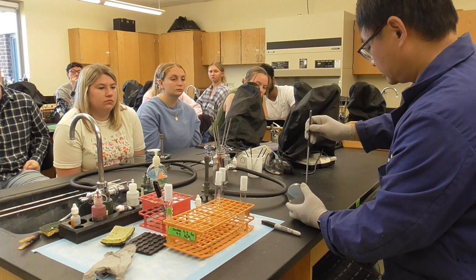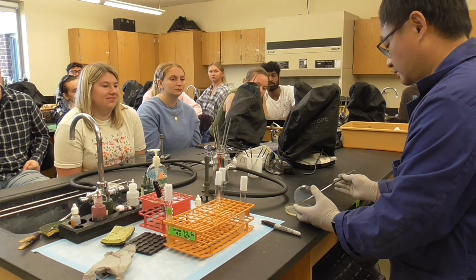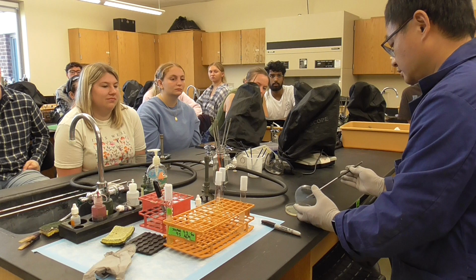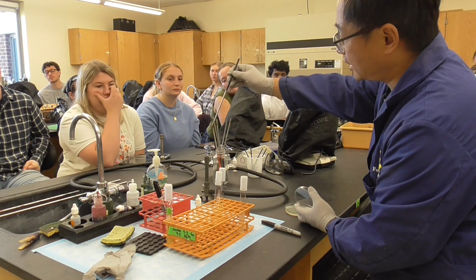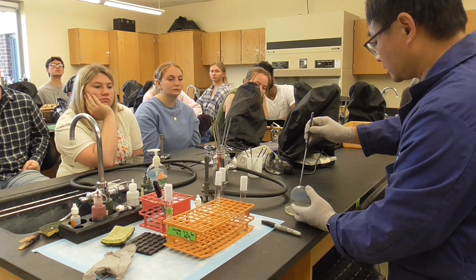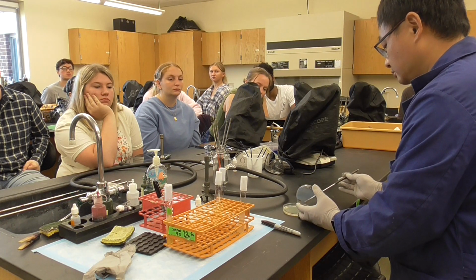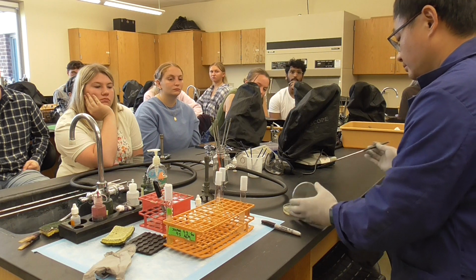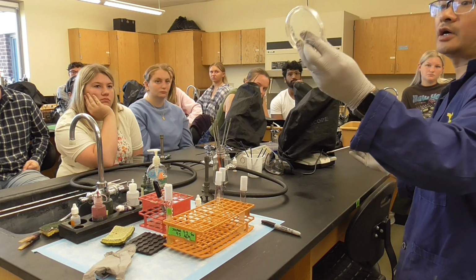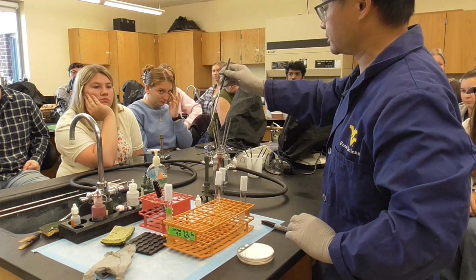Then turn. Right here. Third streak. Sometimes I do third in the lab, but you can do third or fourth. Third quadrant, fourth quadrant, both are fine. Then flame, and on the side, do a last one. And you can see you have a marker there. Okay, you have a four-quadrant marker there, then that's good.